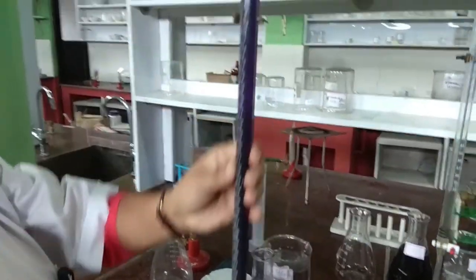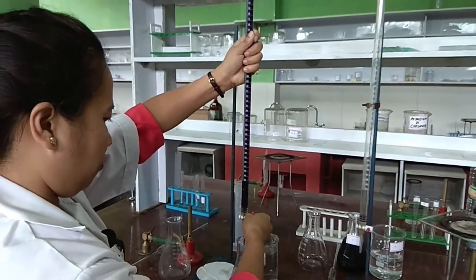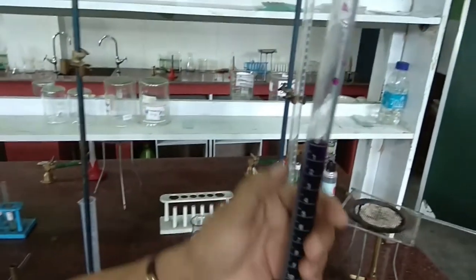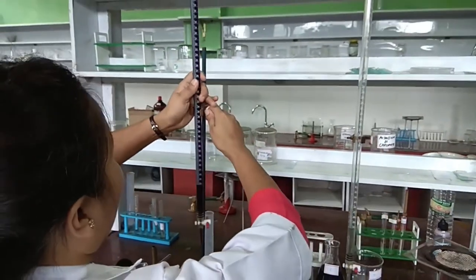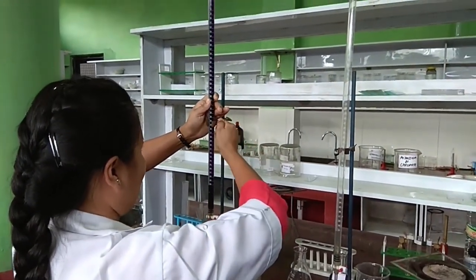Check whether the volume is up to the mark or not — it is a little more. Open the burette and let the liquid fall. Now we can see that the burette is filled with KMnO4 up to the zero mark. Place the burette back and keep it.